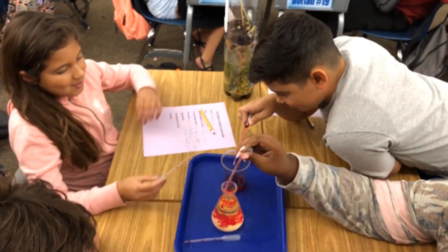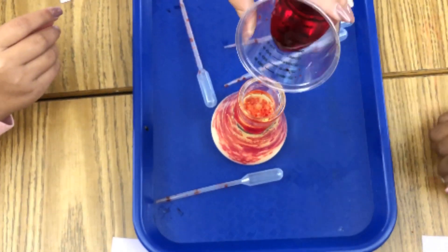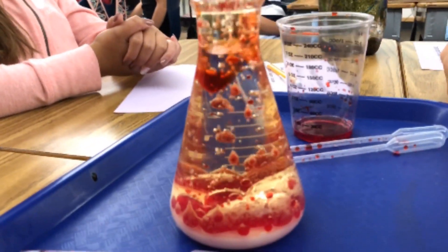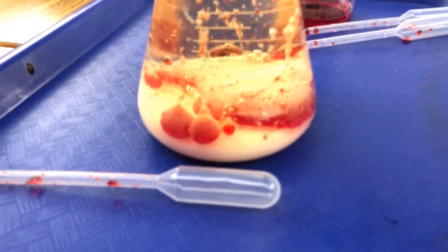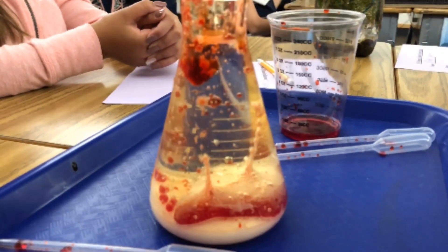That's a great green lava lamp. Now I'm coming to table six. Add your catalyst and see what happens. Pour as much as you can in there — that's great, Mariah — because we'll get a better reaction. Look at those bubbles! So this is a decomposition reaction. We have NaHCO3 at the bottom — that's your sodium bicarbonate — decomposing into carbon dioxide gas and sodium acetate. The sodium acetate stays at the bottom, but the carbon dioxide rises because it's less dense than the oil. Feel the flask — is it cool or warm? Cold. So is it exothermic or endothermic? Endothermic — it's cool to the touch.